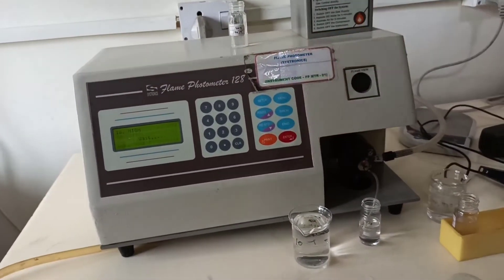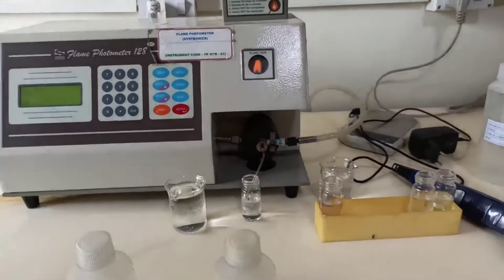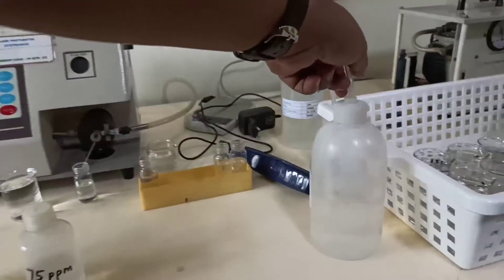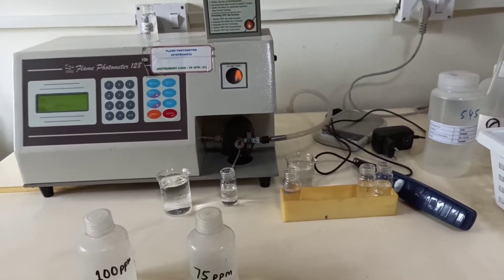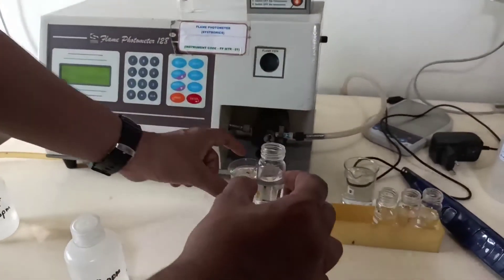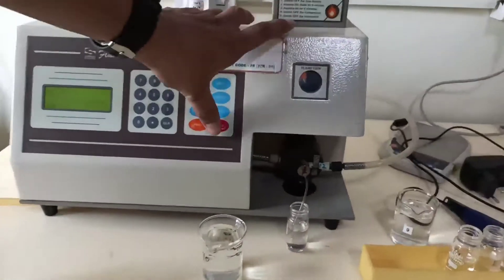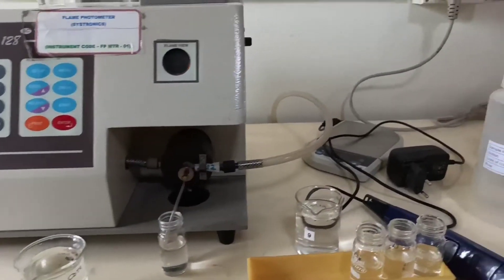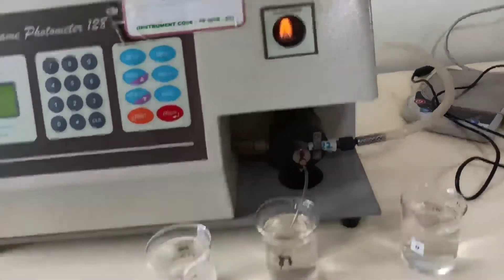You can see the instrument taking the standards one by one and the flame color intensity is changing from high intensity to low. The air compressor is maintained between 0.4 to 0.5, and we are using LPG gas. You can see the drainage pipe behind the instrument. Now we are taking our last standard, in which the concentration of sodium is 25 and the concentration of potassium is 5. This instrument is not too difficult to operate — the instrument gives instructions one by one and you just need to follow them.